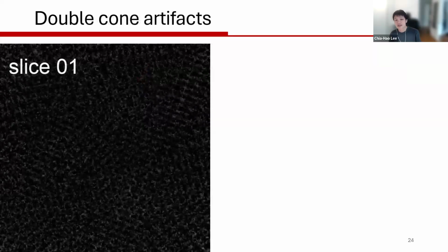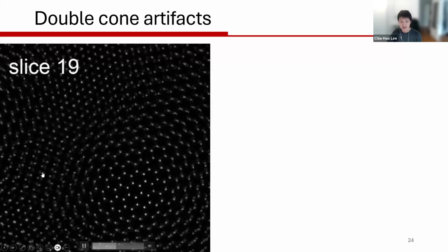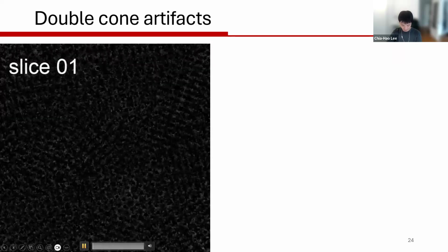Okay. And here comes another artifact in your object that we don't typically talk about as much. Here I call this the double cone artifact, and that is because if you run the twisted bilayer WSe2 data set with extensive vacuum, you're actually going to see these. Did you see how there's a ring irradiating in such a way, in focus, and irradiating out? I'm just going to play this again.